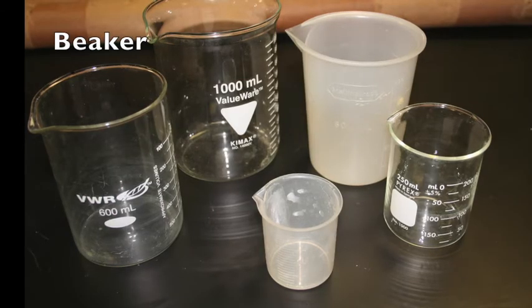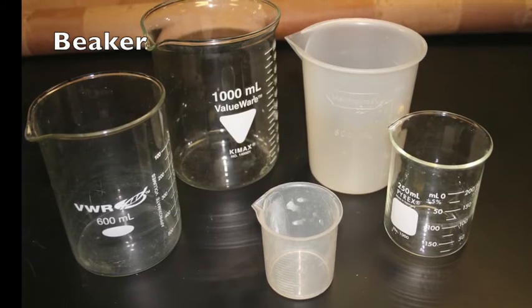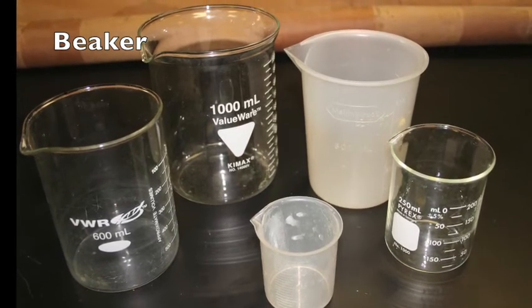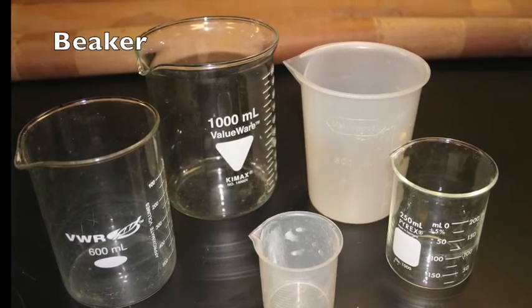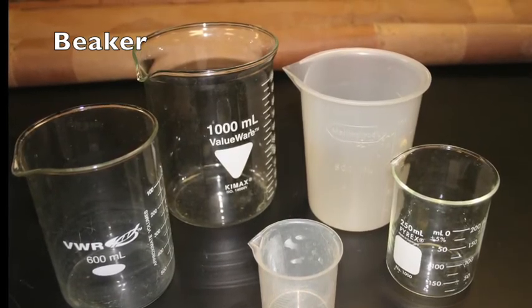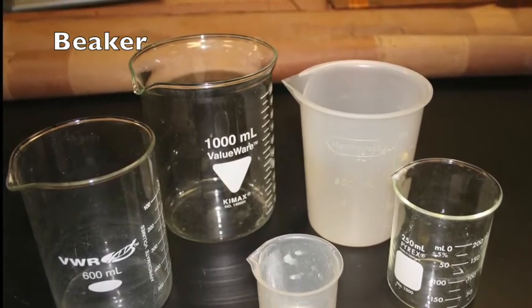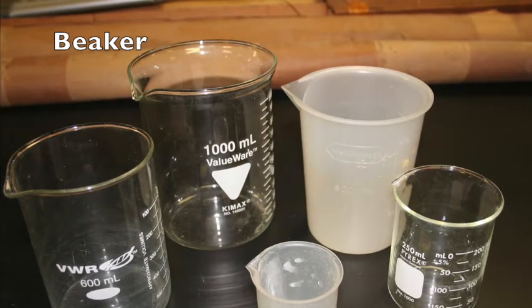There are other tools that are used during scientific study that are useful for purposes that do not involve measurement. A beaker is a container that is used to hold solids or liquids. It may be made of glass or plastic. Although it has volume markings on its side, these markings only approximate the volume and should not be used for measurement purposes. Beakers are typically available in a variety of sizes that may range from 50 milliliters up to 1,000 milliliter capacity. Note that the shape of the beaker is uniform in diameter from top to bottom, and there is a pouring spout at the top.